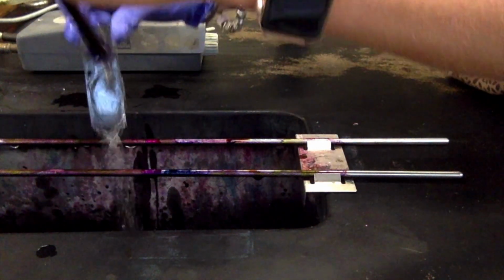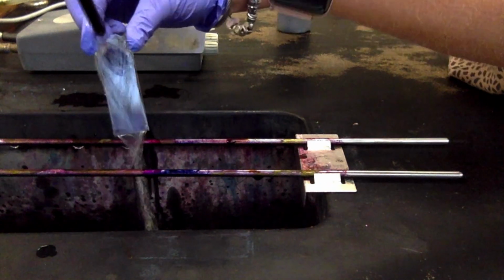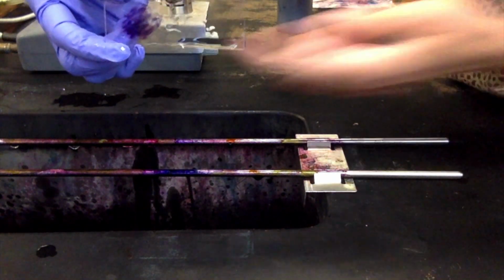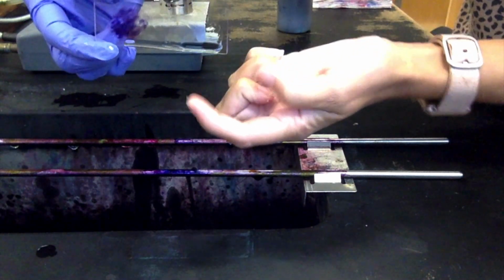That should be good enough. Now we're going to rinse. Okay, remember, you want to make sure that you rinse after the decolorizing step, because you don't want that alcohol to stay on there any longer. Now, if you look at it, you will see that the staph smear is still there, and my E. coli looks like it's completely gone. Don't freak out. It's still there.